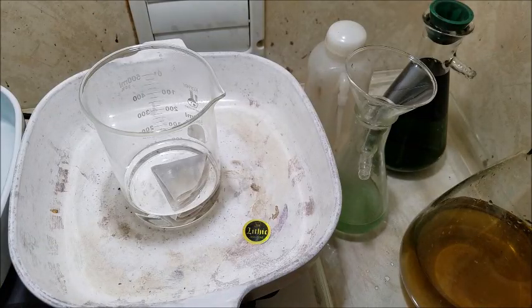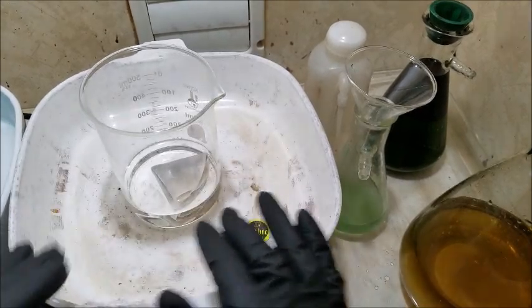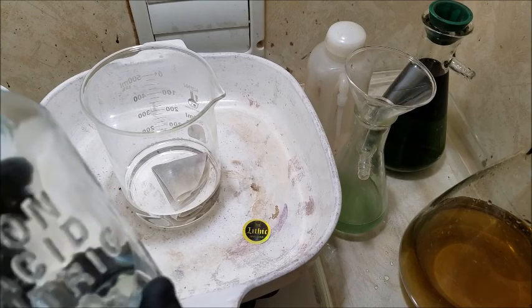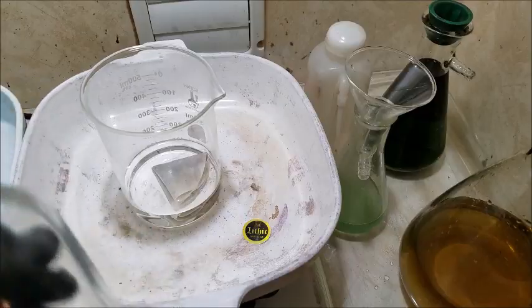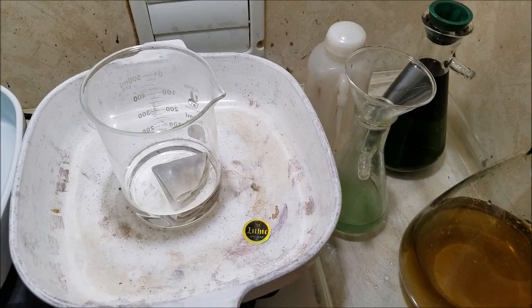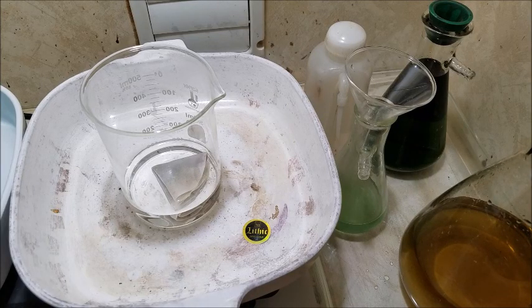If this precipitant is near fine gold, our reaction here should be pretty predictable. I'm going to add some concentrated nitric acid to our hydrochloric acid. Sorry, I'm thinking about something else. And we should see an immediate reaction.